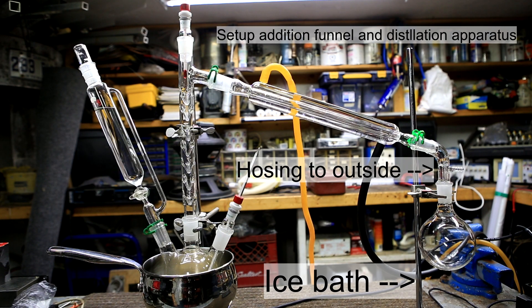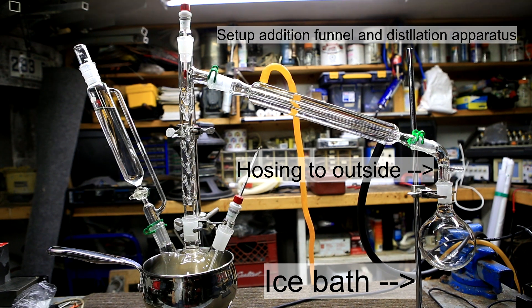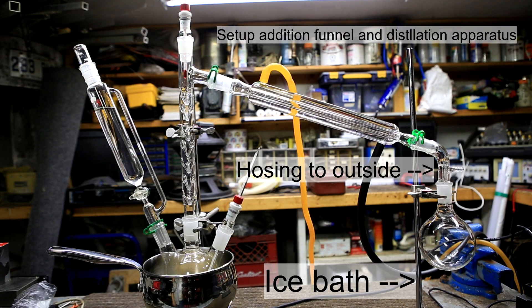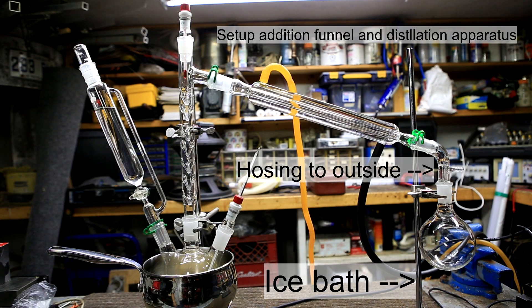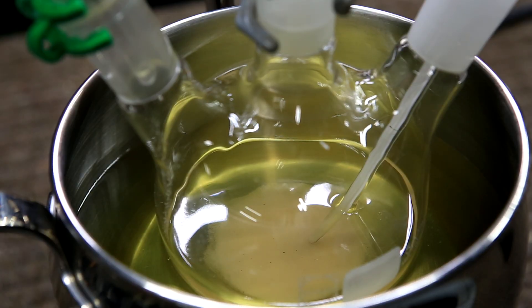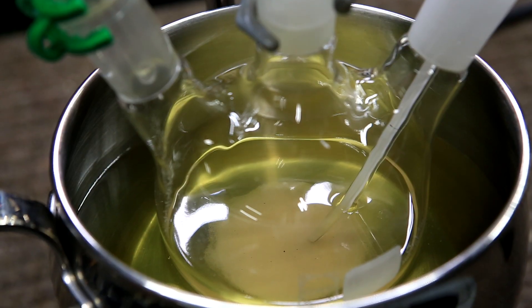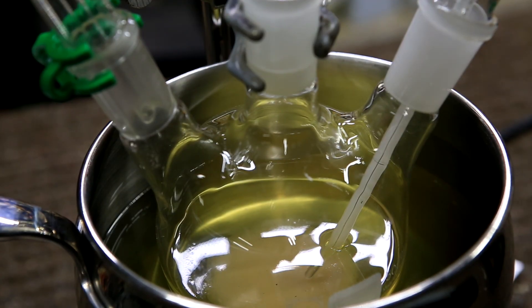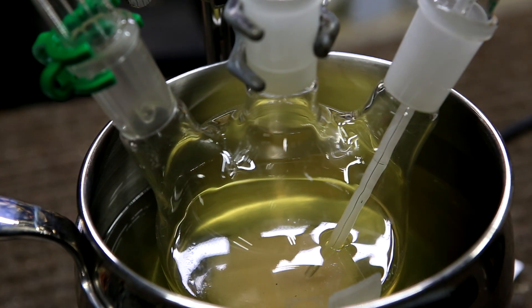I don't show it here, but a hose leading outside was attached to the vacuum adapter and an ice bath was set up underneath the receiving flask. Keep in mind, it might not appear this way, but this area is extremely well ventilated. The hot plate was turned on and the oil was heated.